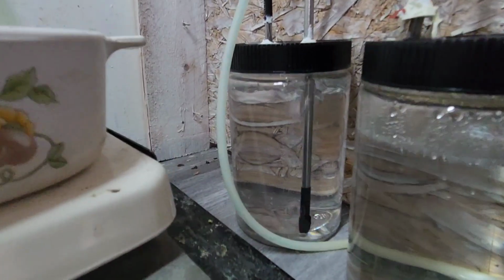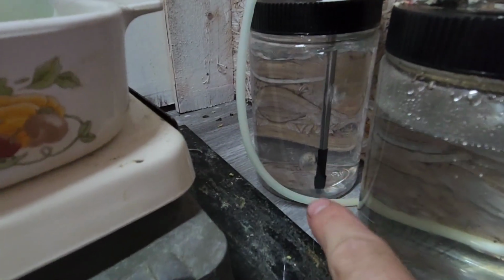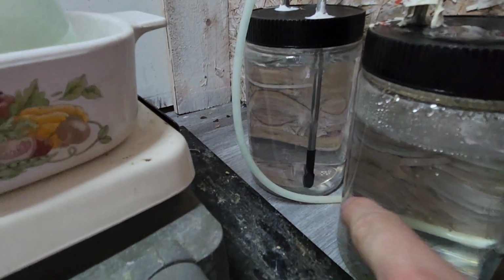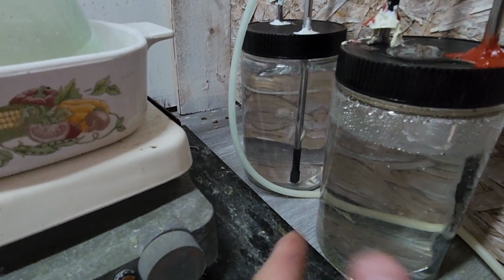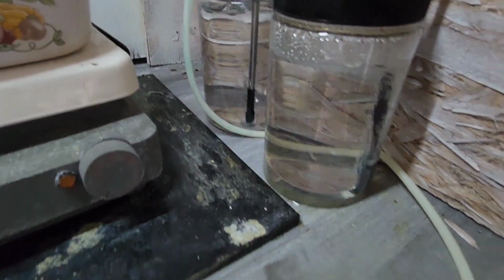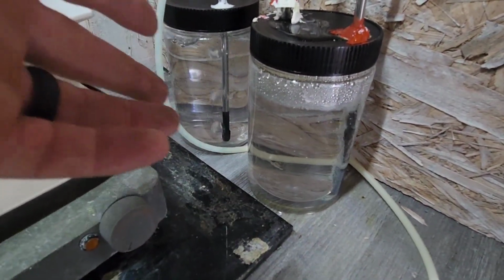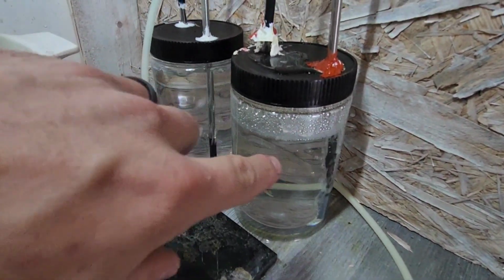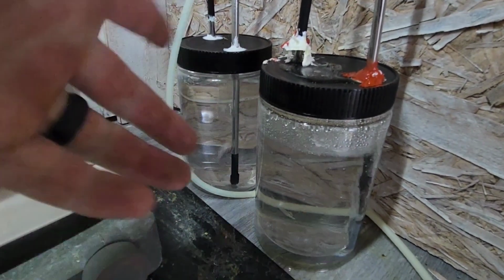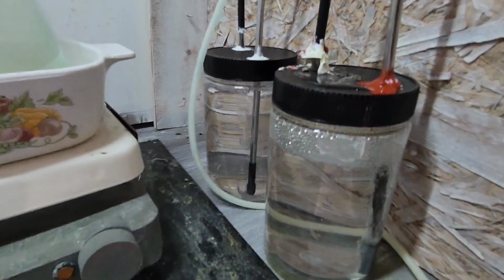So you can see just from the evaporation, we have, well, one, you can see a bunch of liquid stuck in the tube. So that'll be solved with my just cleaning up my tubing. Right now, like I said, it's just kind of hanging here. But we don't want that to overflow and then have nowhere to go. So then, you know, that's not going to work.